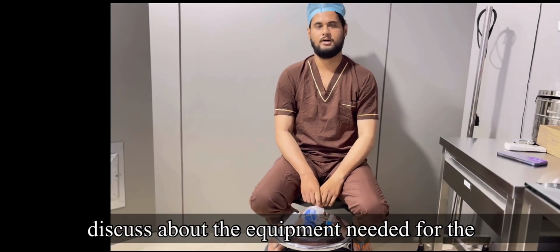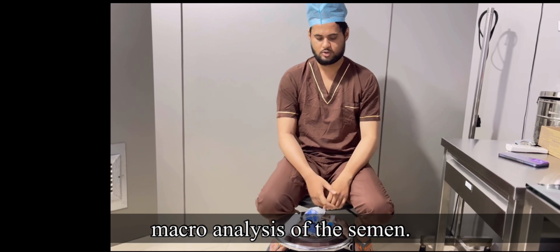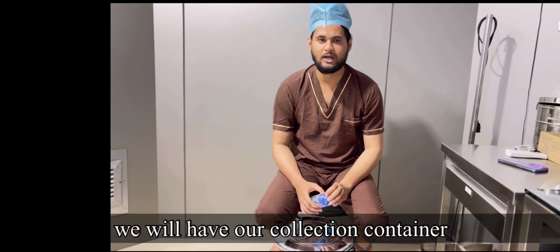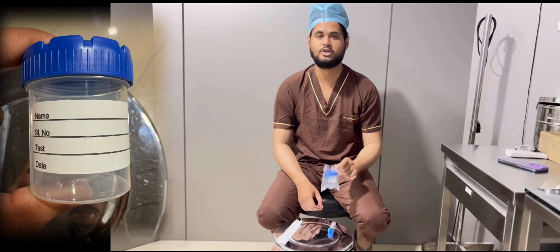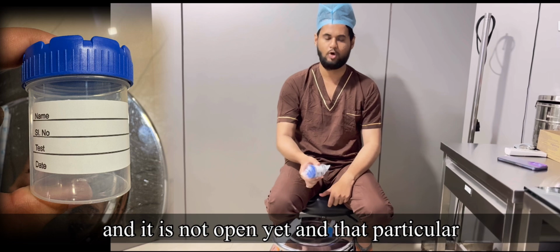So hello everyone, in this video we will discuss the equipment needed for the macro analysis of the semen. When we talk about macro analysis, first of all we will have a collection container in which the semen needs to be collected. So this is the semen collection container. This collection container should be sterile, as it is completely sterile and not open yet.